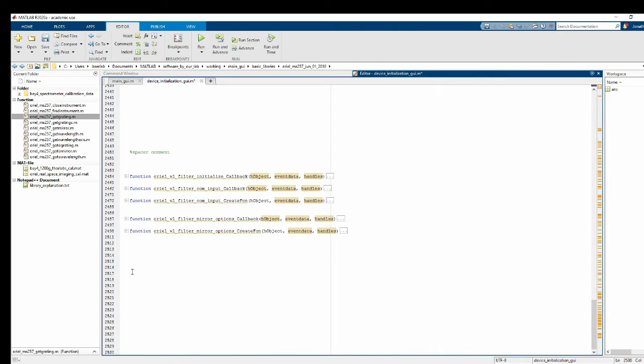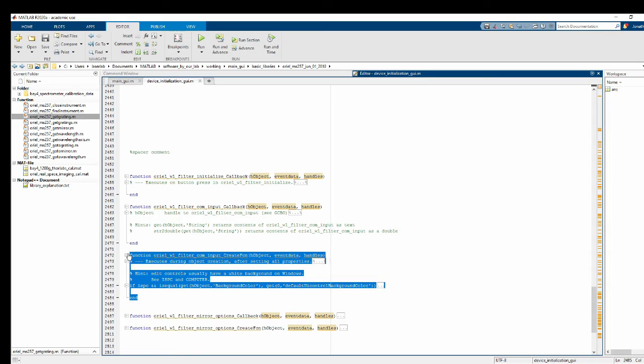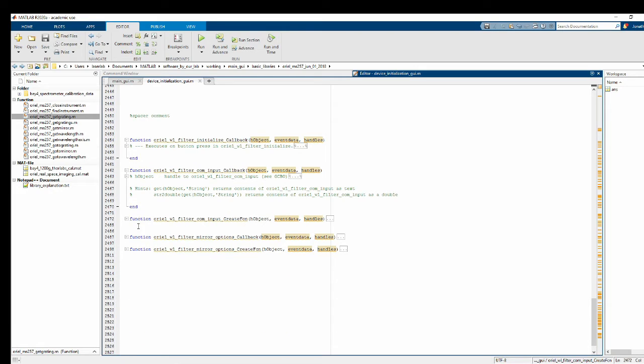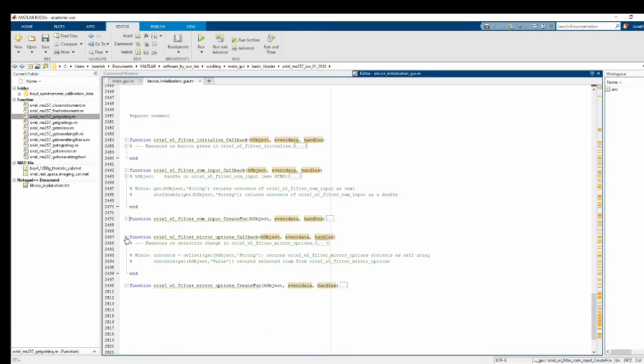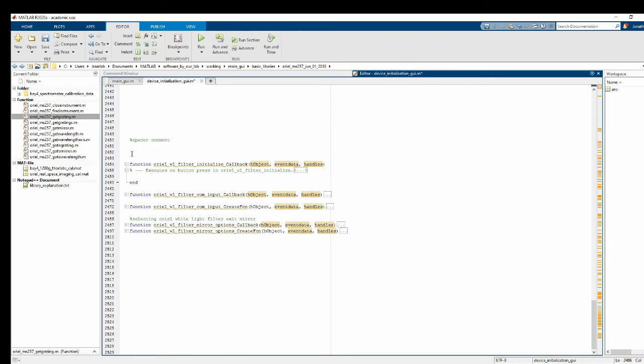Okay. Now what we want to do is code it so that some of these buttons actually do something. So right now all of them are pretty much just blank functions with no real code being executed inside of them. I guess there's something here. Well, this is a creation function, so we don't care about it anyways, really. Really what we're going to be interested in is these callback functions. So let's see. These two are for selecting the exit mirror. And then these three are for initializing communications.